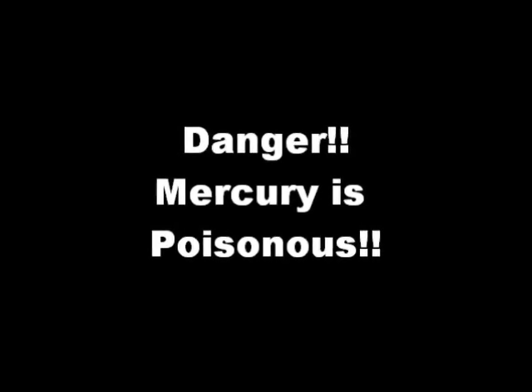Warning. Mercury is a highly toxic compound. Do not attempt this experiment unless you are trained in handling this type of toxic compound.